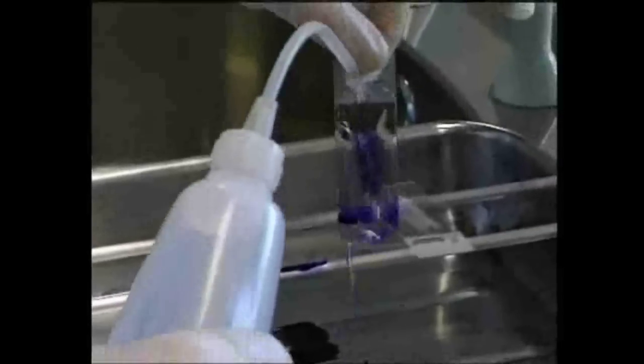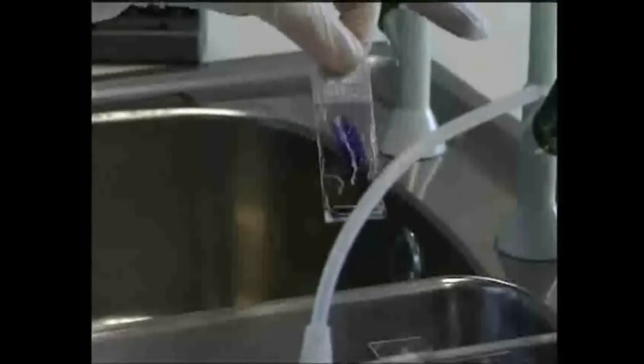After the minute has passed, tip the stain off the slide into the tray. Then rinse the slide, front and back, with water, and place it back on the tray, again with the smear facing upwards.